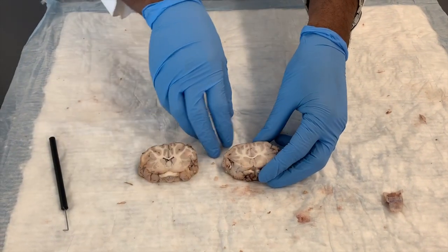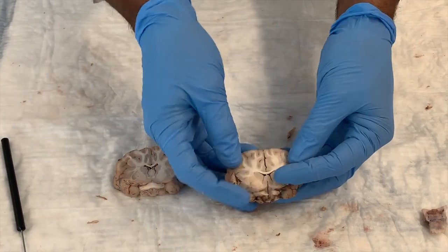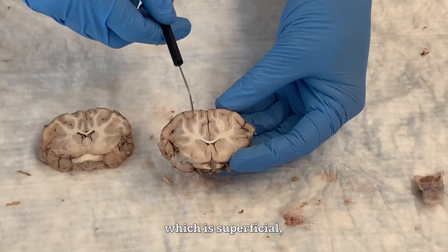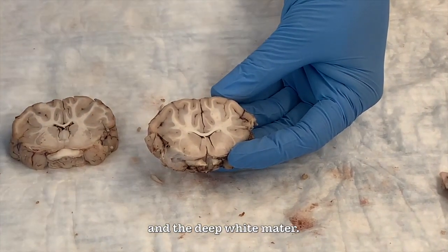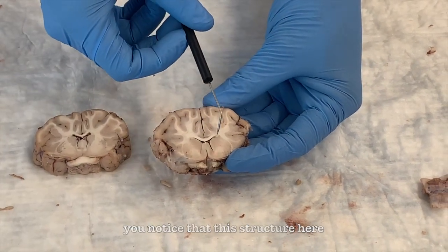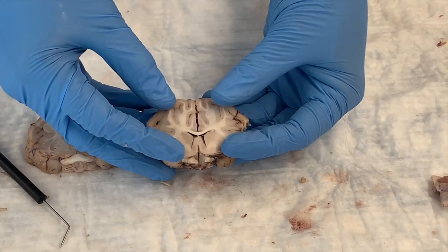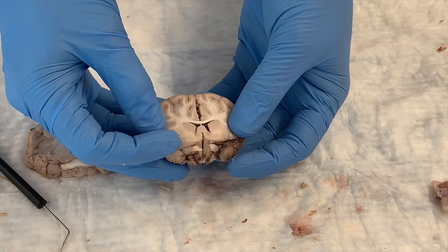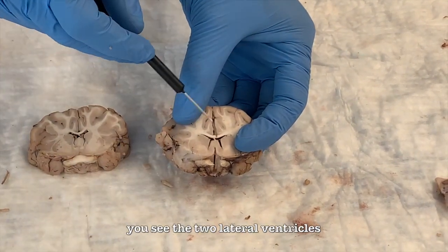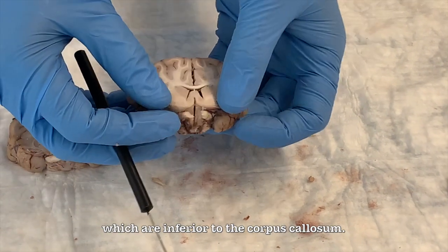This part of the video aims to show you the structures of the brain that are visible from the coronal cuts. What you can see first is the gray matter, which is superficial, and the deep white matter. And you notice that this structure here is the corpus callosum, and it is connecting the two cerebral hemispheres. And as you see here, you see the two lateral ventricles, which are inferior to the corpus callosum.